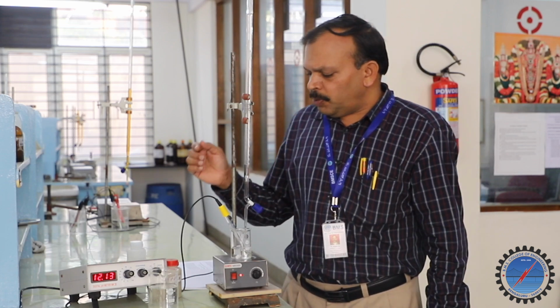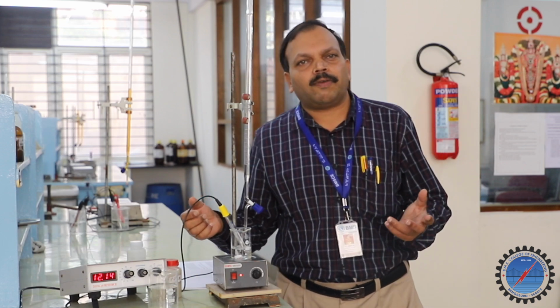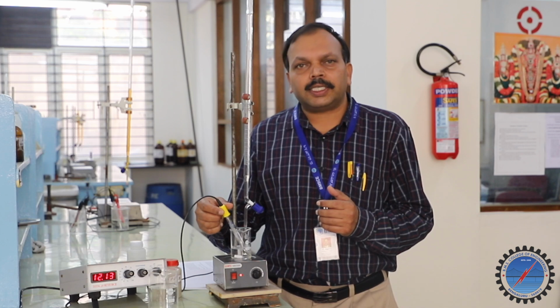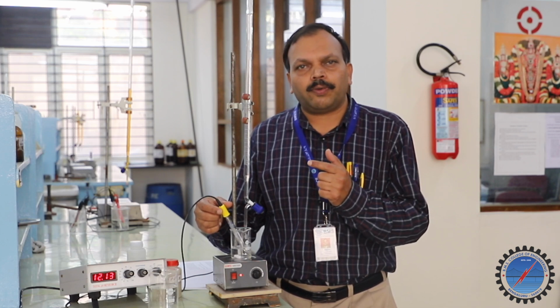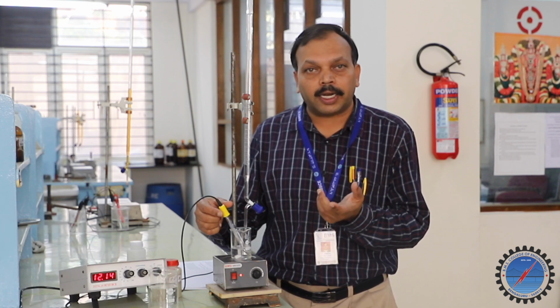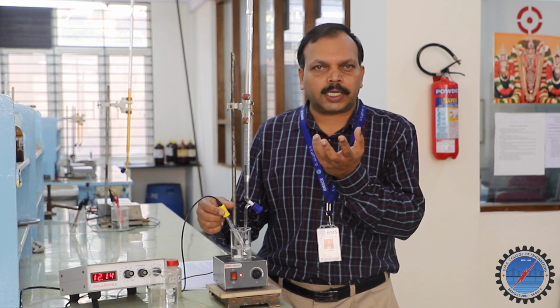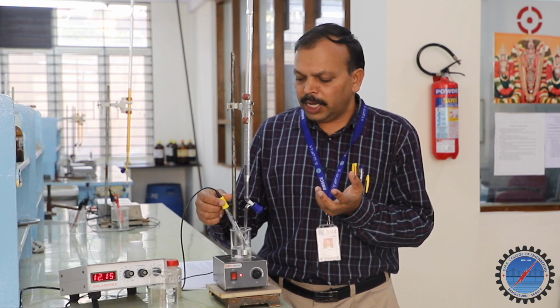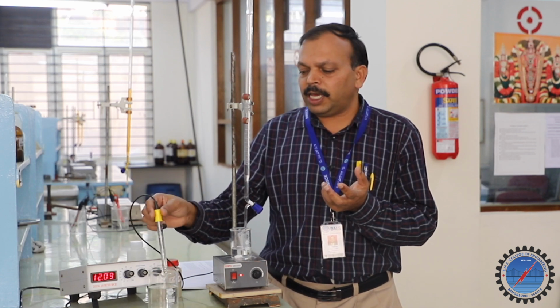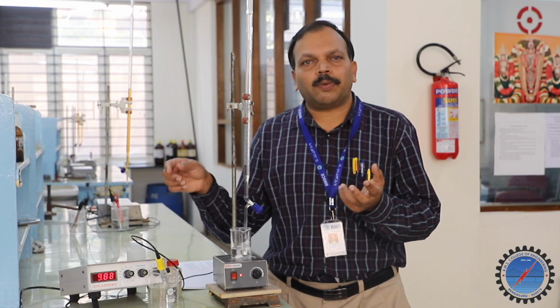One limitation you may already be familiar with, maybe studied in the theory, is the limitation of ion selective electrodes, particularly the glass electrode. We should not retain the glass electrode in a beaker containing a solution in the high alkaline range, which affects the glass membrane specially used to construct that particular ion selective electrode. Immediately, I am going to take it out of the experimental solution. I will keep it in another beaker which contains just distilled water.